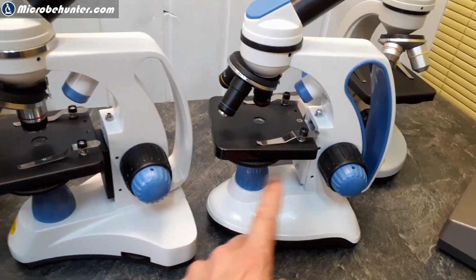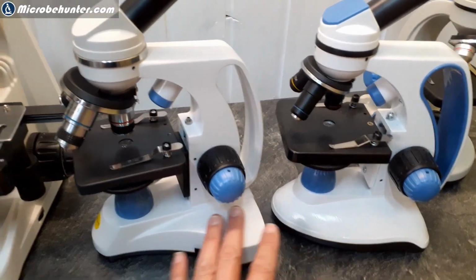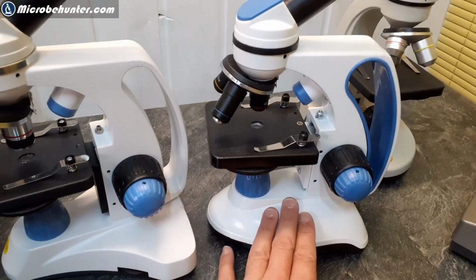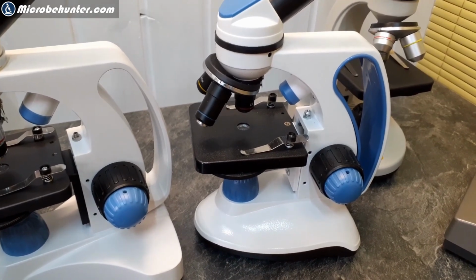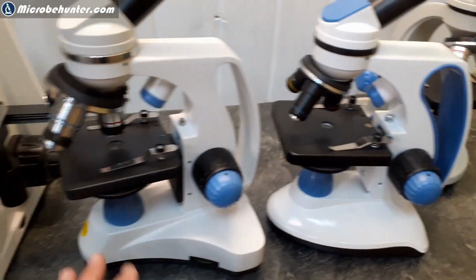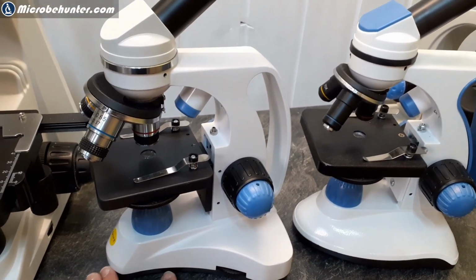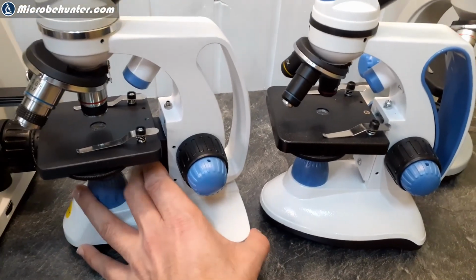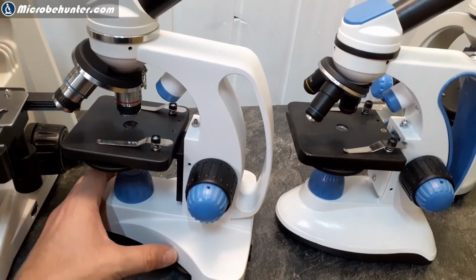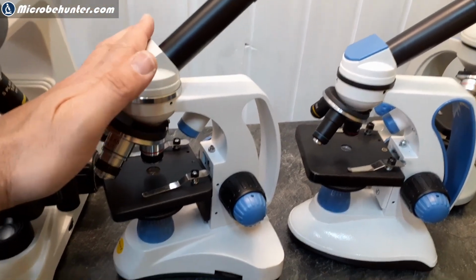Indeed, many of the parts are the same because those microscopes are all manufactured in China and then imported and rebranded. But this one here, the old TED, is really nice because it comes along with very good documentation, a set of very nice slides, good support. And this one over here essentially comes in a brown box, and with very little documentation. So you see, sometimes this also contributes to the price difference. This one is also a little bit more expensive, one has to say.